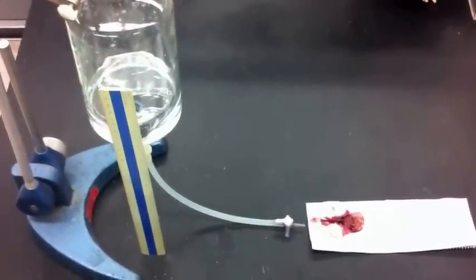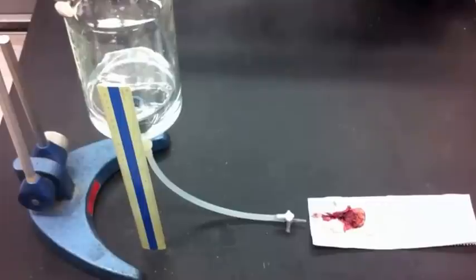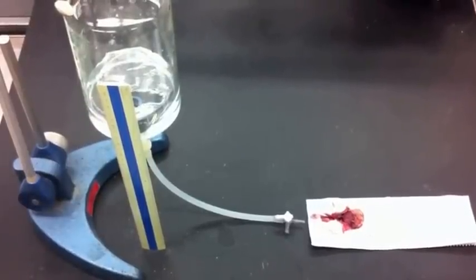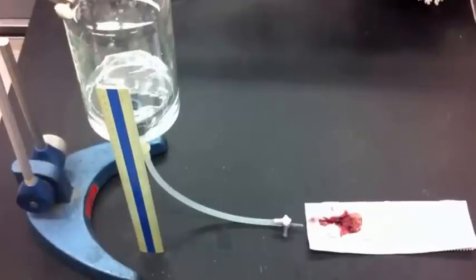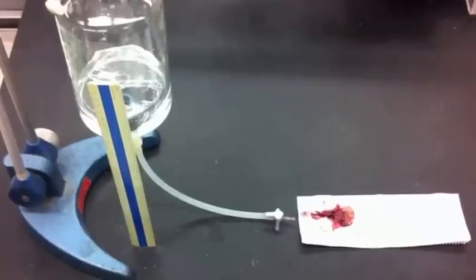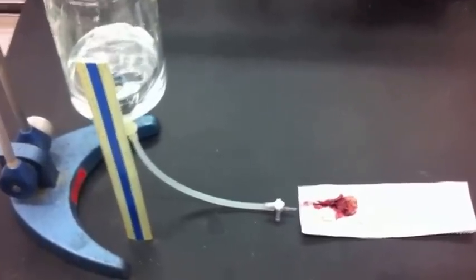We've moved the mouse over next to a reservoir filled with the fixative. Technically this should be done under a hood, but we've taken it out of the hood just for demonstration purposes. The fixatives — whether formaldehyde or glutaraldehyde — should be handled in the hood.